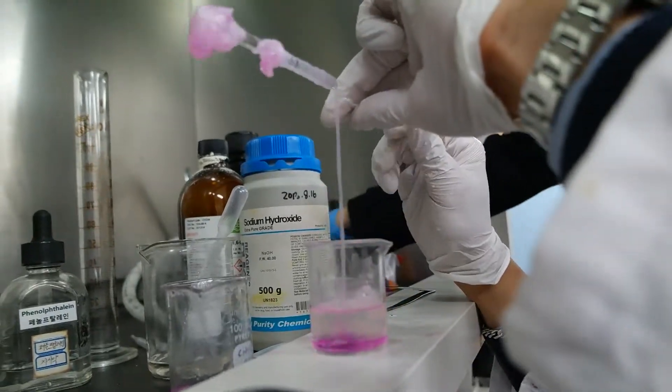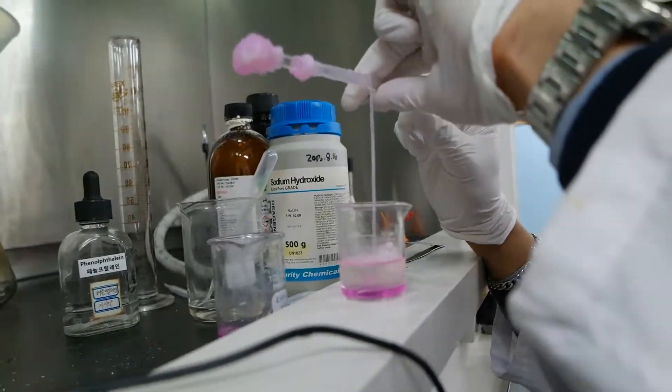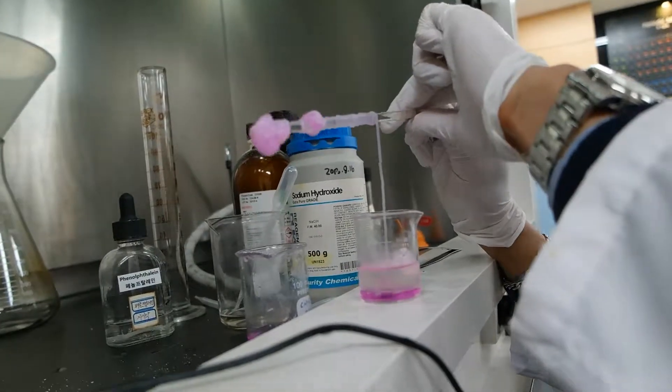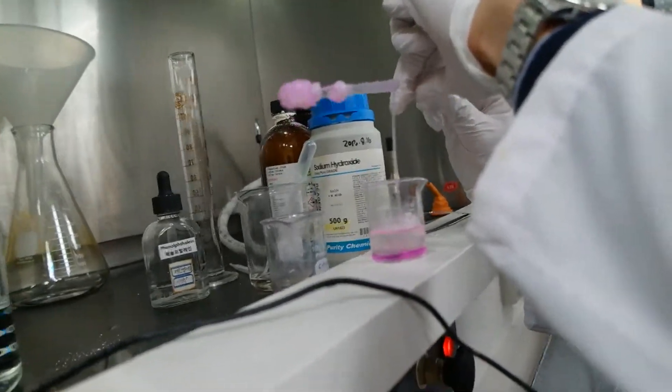So I guess when you guys are doing it, you might have to mix this one. Oh, careful, careful. I don't want this to go in your eyes. I think even when you're filming it, you should be wearing goggles.